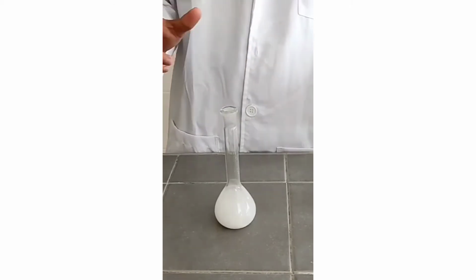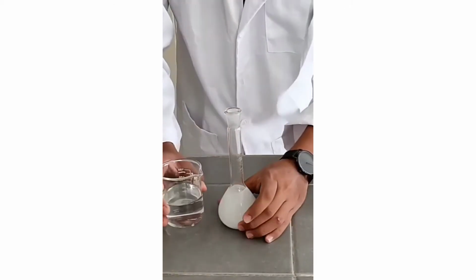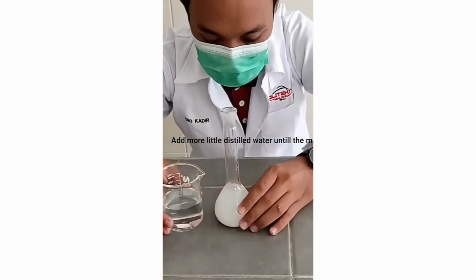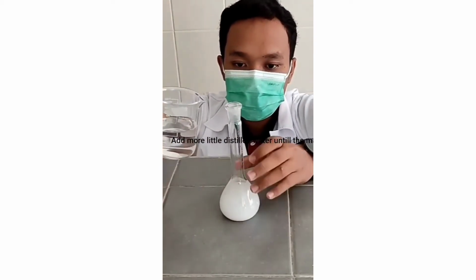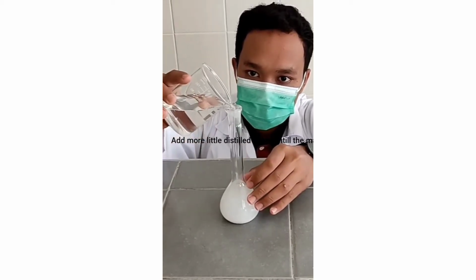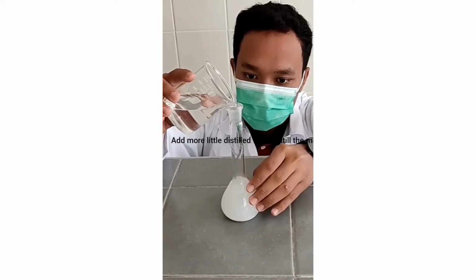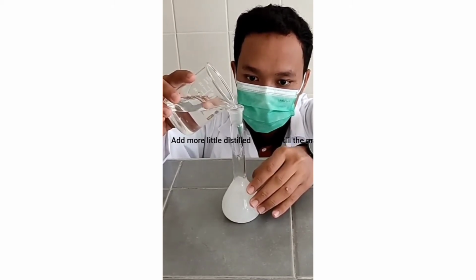Then we must add distilled water to the volumetric flask until the mark. We will add again until the mark.